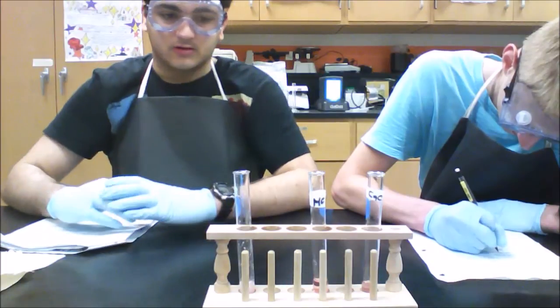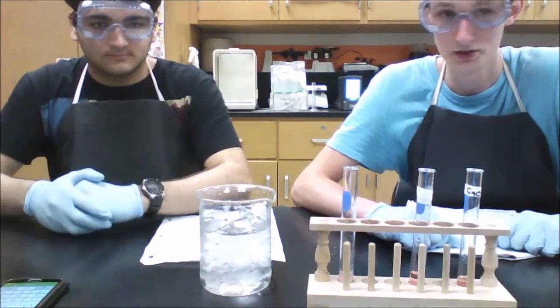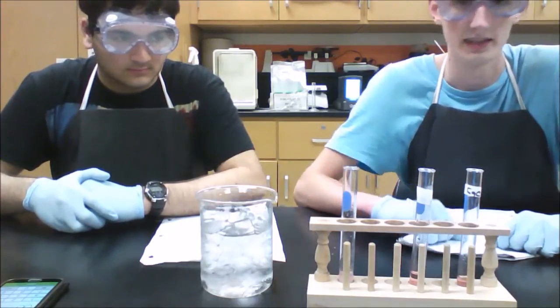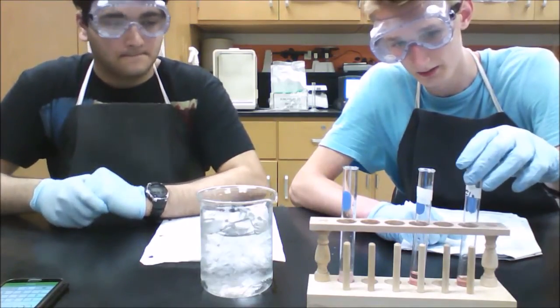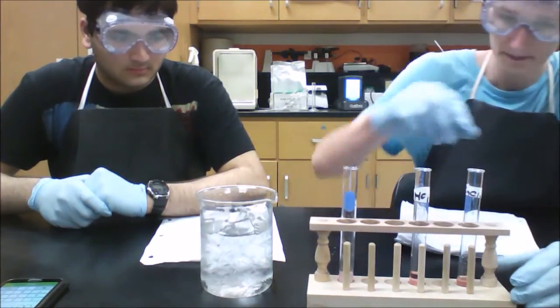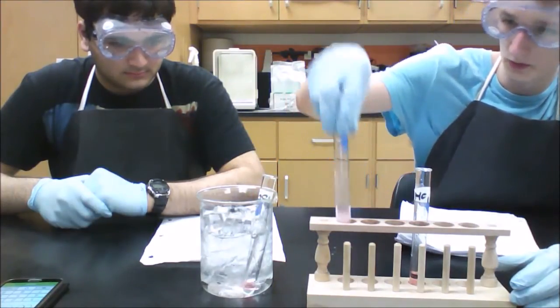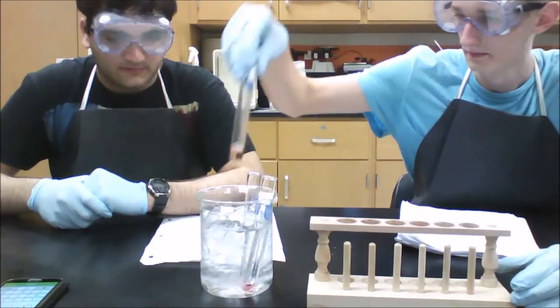So now let's move on to the heat and ice experiments. This is a continuation of the guided inquiry, where we're using the ice bath to test the equilibrium change in each one of these, including our cobalt solution, calcium solution here, our HCl solution here, and our silver nitrate solution here. So we're going to put all 3 of them in our ice bath, and we're going to observe the color change within them.